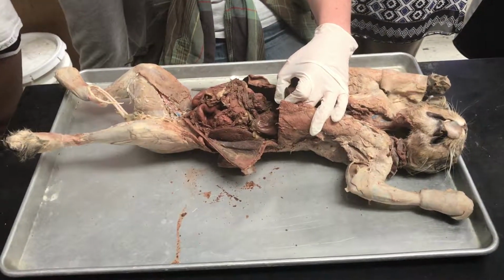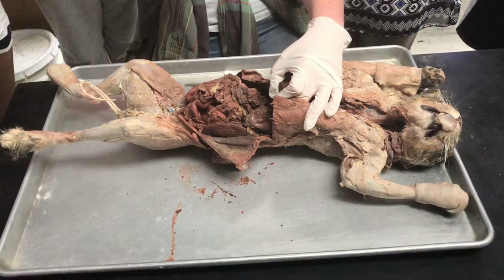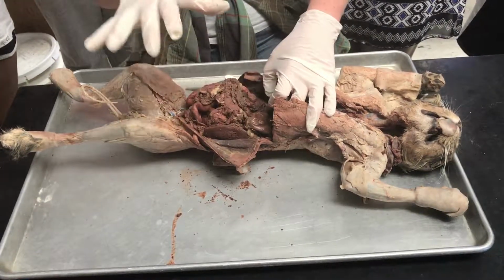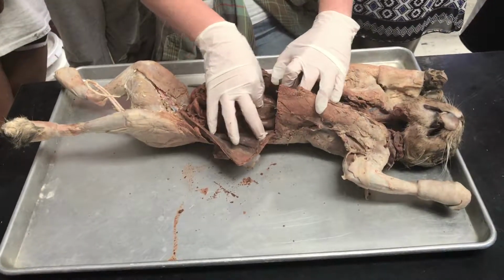And then there's the cardiac sphincter, which you can't see, but what it looks like inside is it's a smaller opening than what the rest of the tube would be. And it's a muscle, so it just constricts, and that's how the sphincter works. It constricts to hold things in the stomach and prevent them from going back into the esophagus. And the same thing with the stomach at the small intestine. So coming out of the stomach, we're going to go into the duodenum.